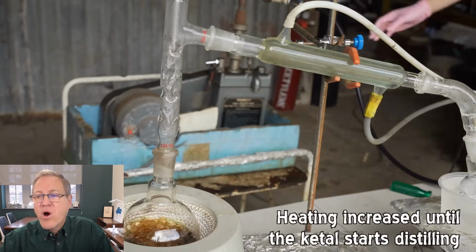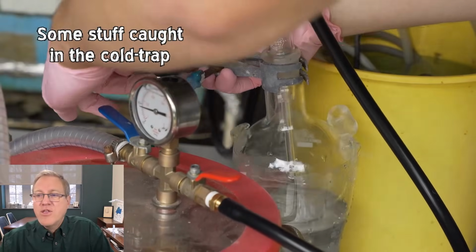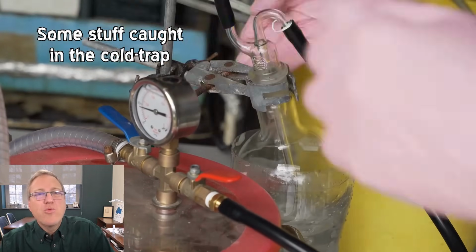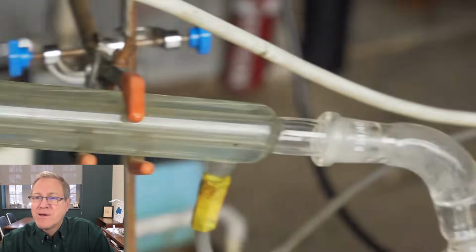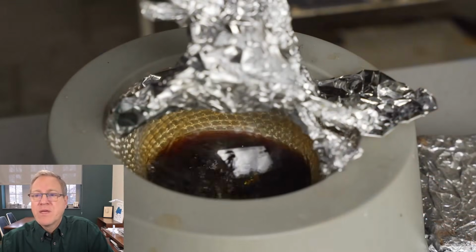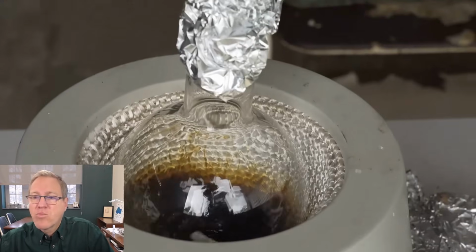Now, presumably, this is product. You can see it boiling through that distillation column, collecting there. You often put a trap that will help prevent any unwanted vapors from getting pulled into your vacuum pump. That protects your pump. He's watching stuff, looking good, looking good. That's beautiful, clear, colorless product that he's collecting. The colored materials tend to be higher boiling, so you normally can separate the colored material from your desired product.